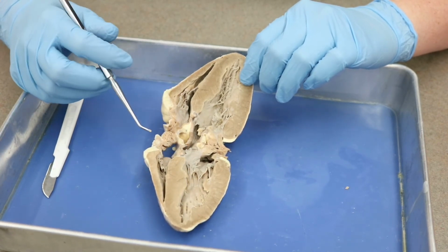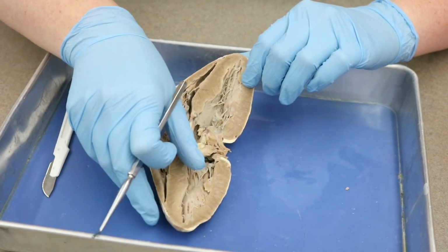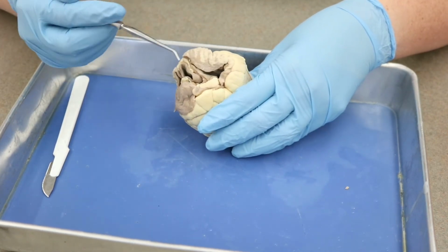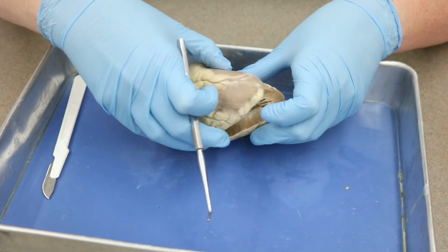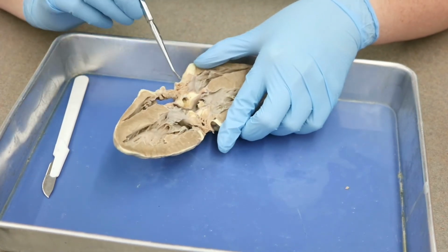Now, the last term that we haven't mentioned is our pectinate muscles. So I'm going to go ahead and close up our sheep heart here. And remember we had our auricles here, and we said the auricles were adjacent to each of the atria. Well, when we open it up, we actually see inside of the auricles here.